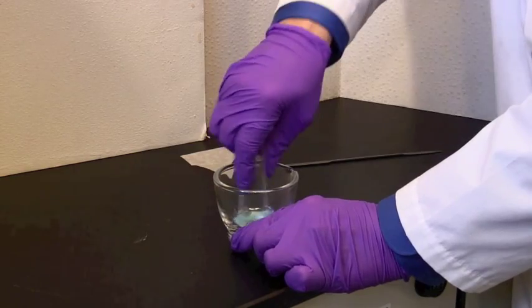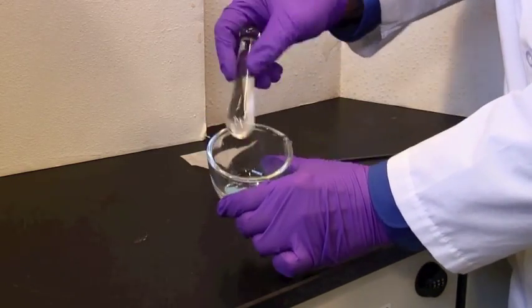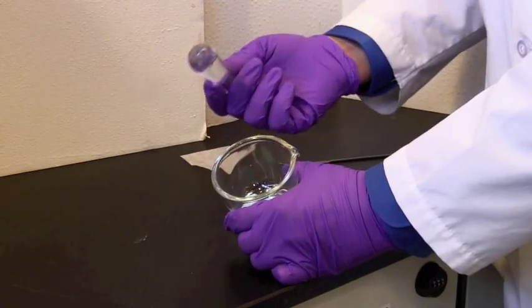Now you'll notice that this is really quite pale and quite powdery now. So this has now been ground appropriately.